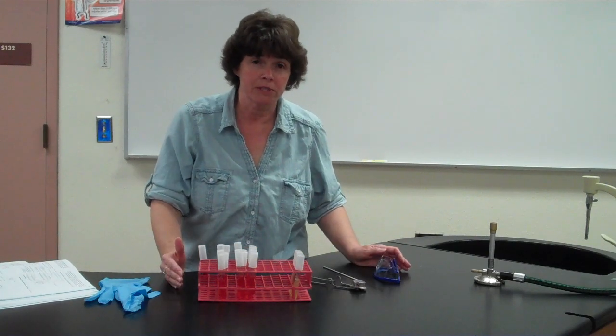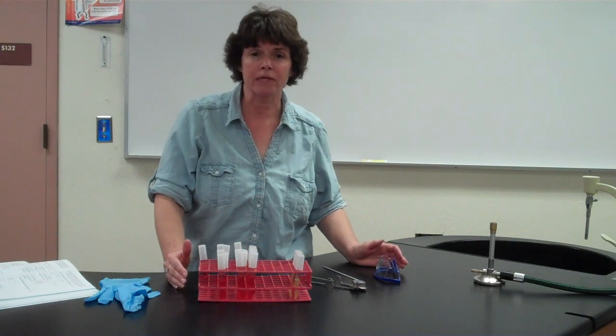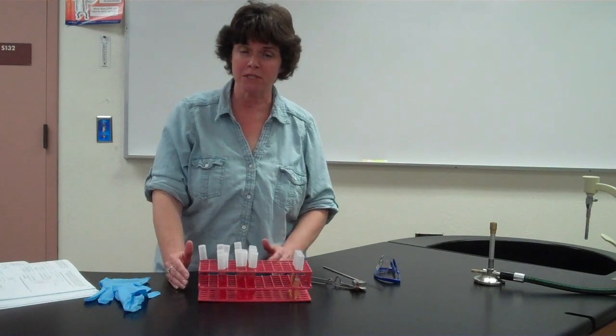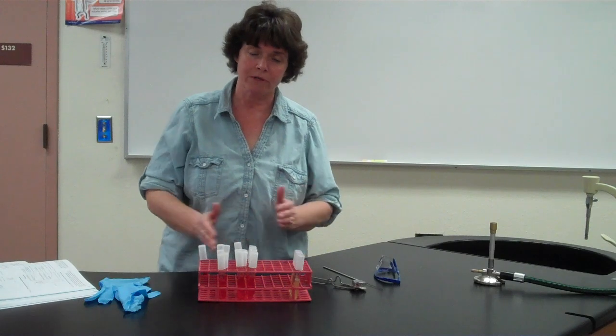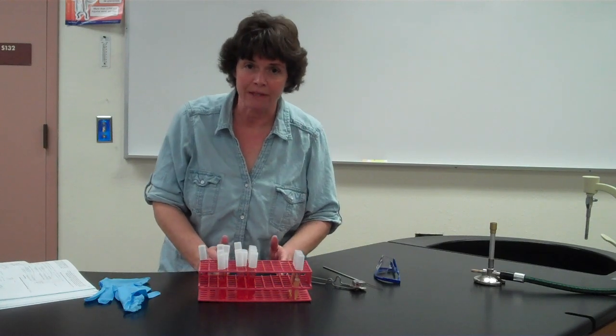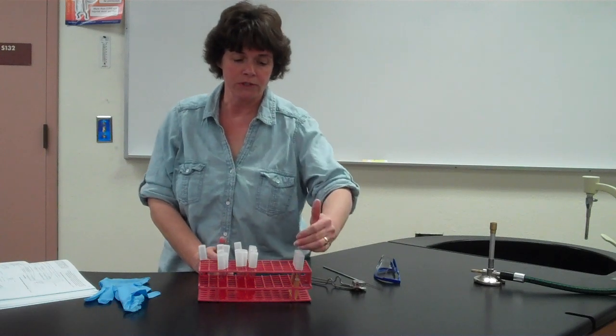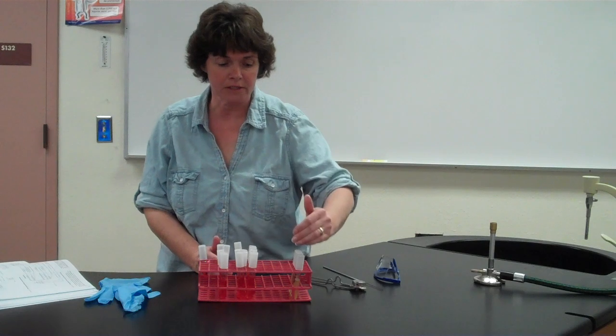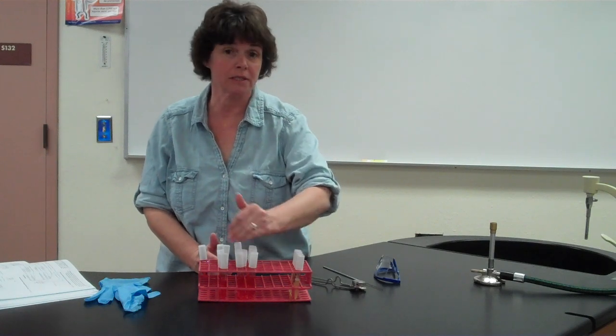Simultaneously, you might also be doing other labs such as the urea, the urease, or the litmus milk. So you might have a lot of tubes to deal with in one class period, so make sure you're very organized, and as a group, you split the work up evenly, okay? Maybe one student will do this bacteria and put it into these 3 tubes, okay? And then a different student does this bacteria and puts it into these 3 tubes.